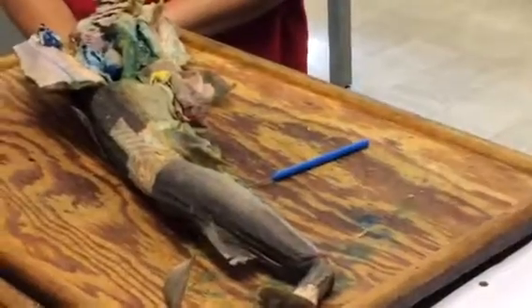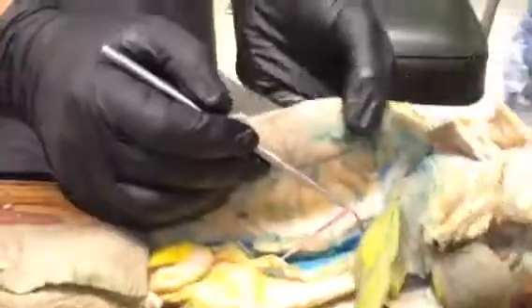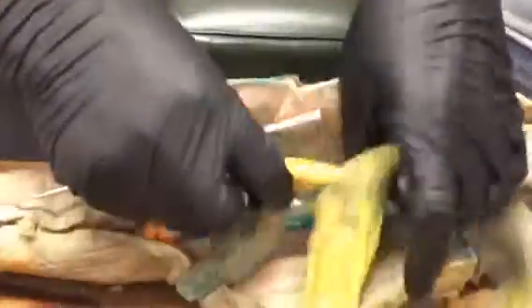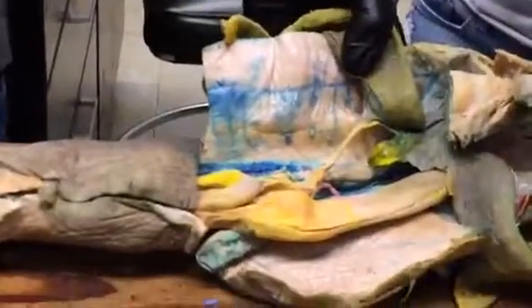These are the four median arteries that run down to the gut off the dorsal aorta. The first one of these you'll find starting very far forward and running very independently. Doesn't really run through a mesentery, it just kind of runs in space here. And that is the celiac artery. Okay. And that kind of dives in and eventually connects up to this region of the lesser omentum. And it has some branches off of it.